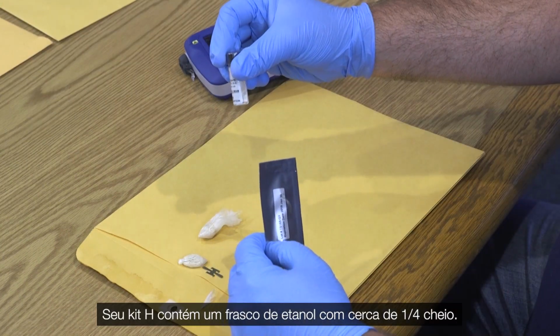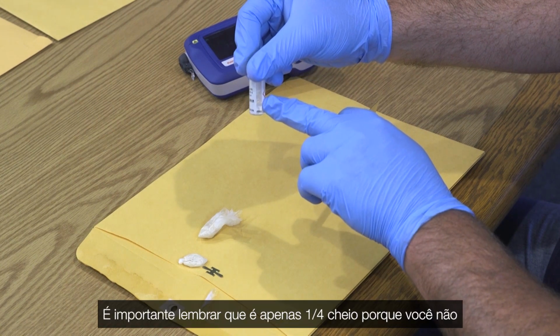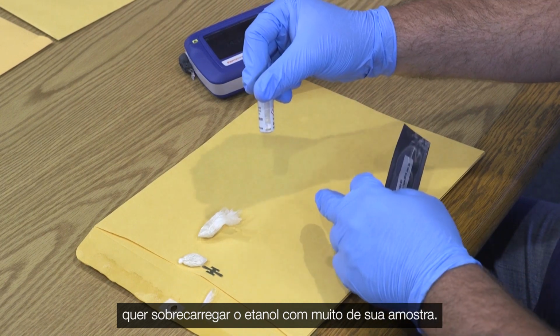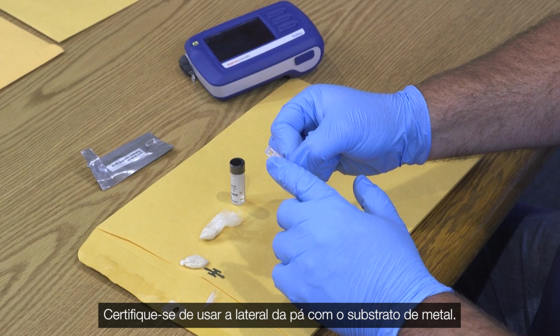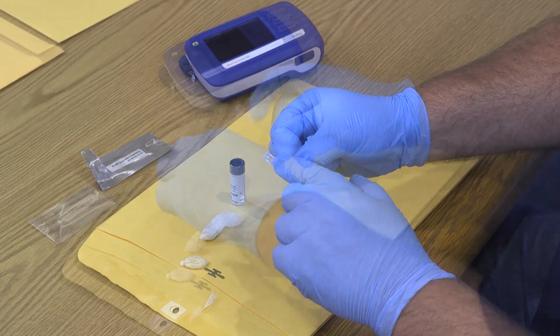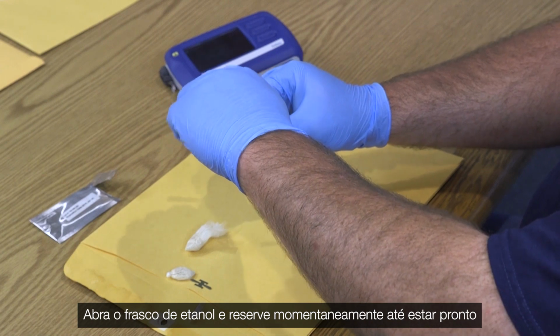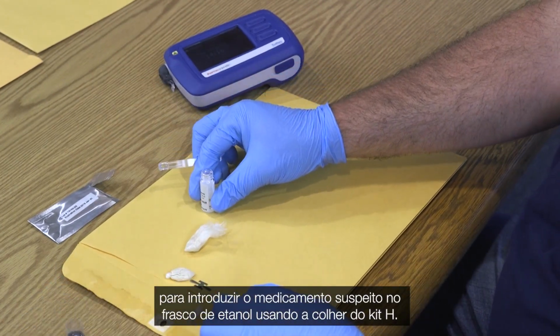Your H-kit contains a vial of ethanol that is about a quarter full. It's important to remember that it's only a quarter full because you don't want to overwhelm the ethanol with too much of your sample. 1 scoop is sufficient. Ensure you are using the side of the scoop with the metal substrate. Open the vial of ethanol and set aside momentarily until you are ready to introduce the suspected drug into the ethanol vial using the H-kit scoop.